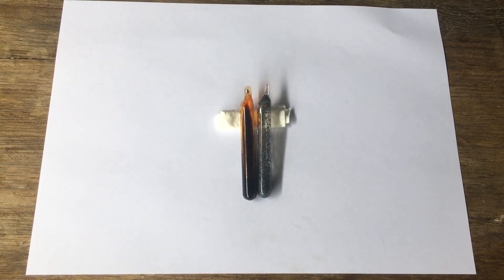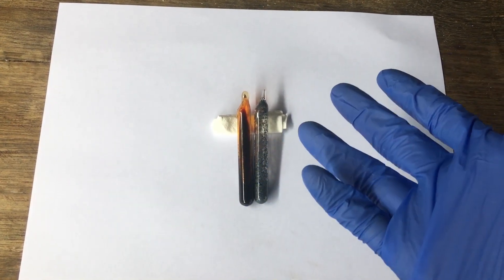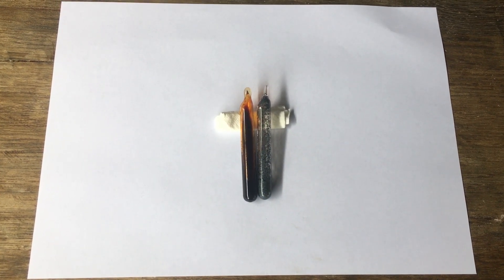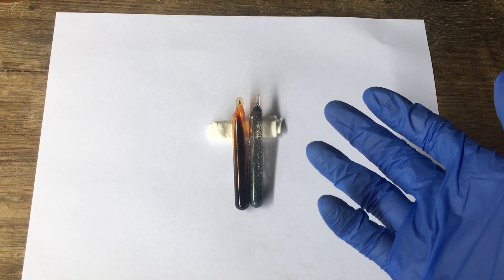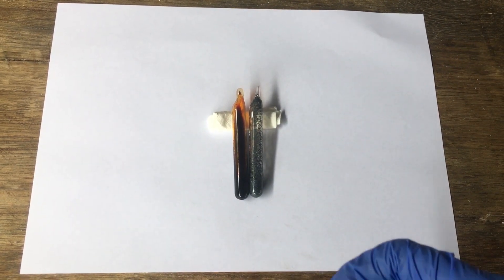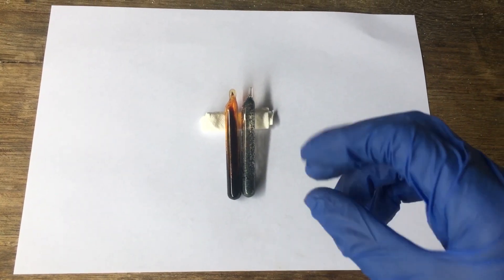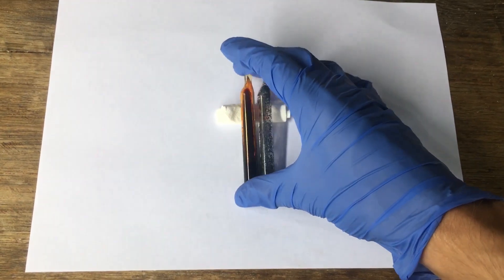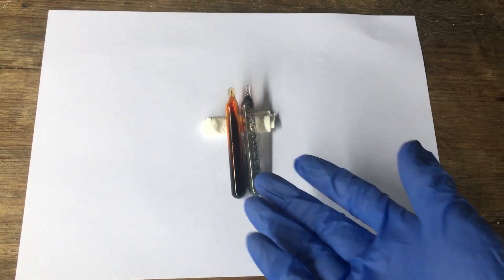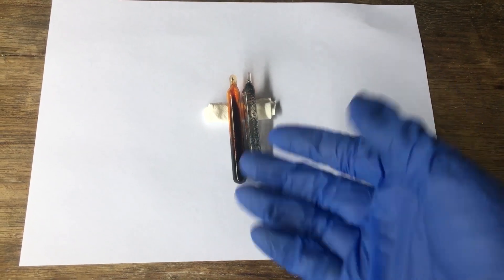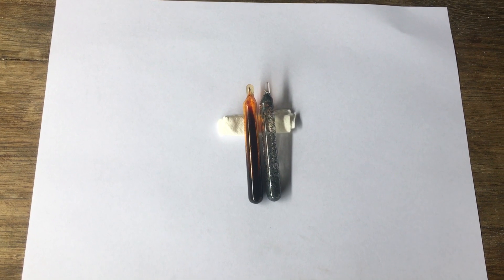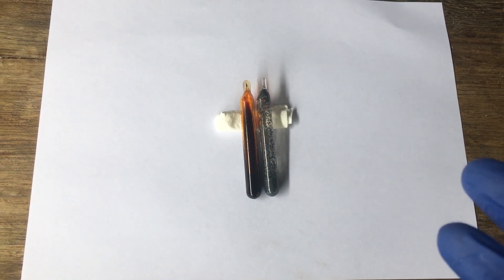So that's what we're doing today. We will be making chlorine gas and putting it in an ampule. Honestly, it's probably just going to be a pretty simple video. In the end, chlorine isn't all that difficult to make and while sealing it in an ampule might pose some challenges, I mean it is a gas rather than a liquid or solid, which are much easier to ampule because you can just put them in the glass test tube and then seal it up.